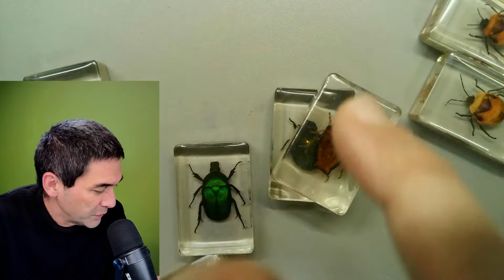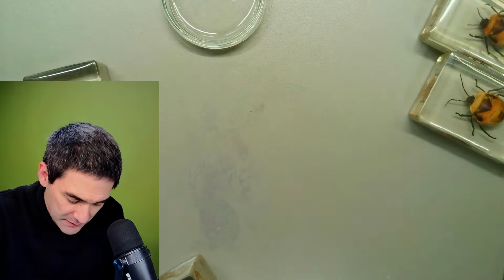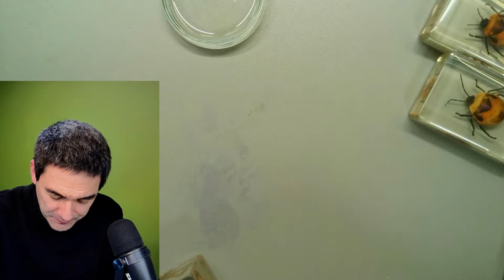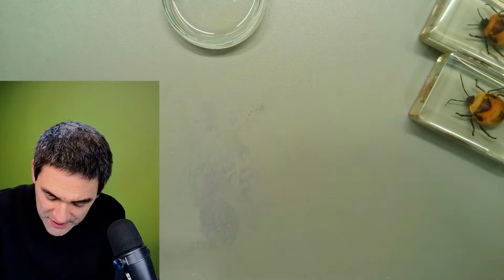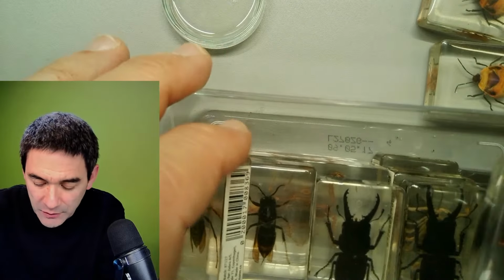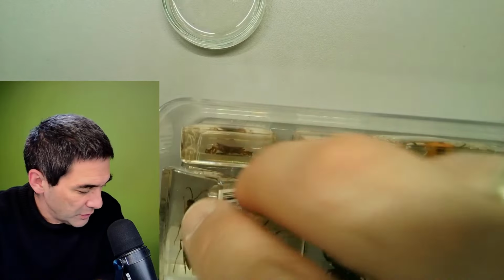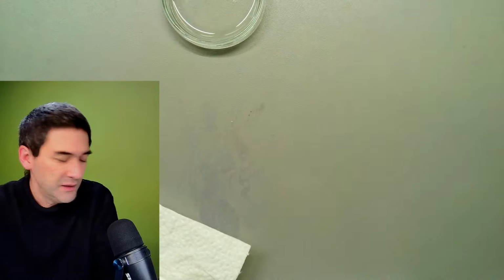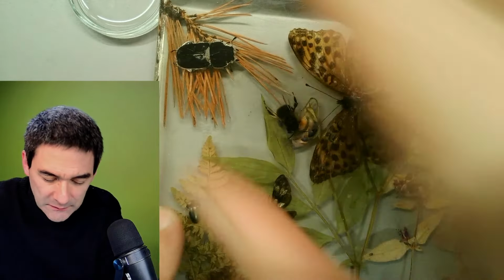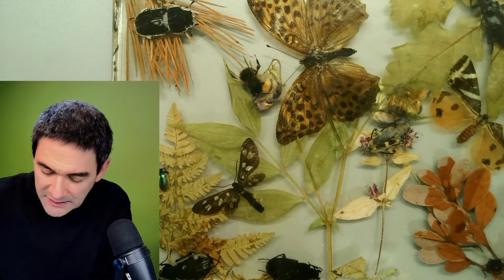So I'm going to have to put the oil somewhere now. And then I'm going to show you something else here. Because I do have another one; these over here are modern ones, right? I do have one over here on the side which seems to be already 40 years old. Let me put this away first. So it goes back into this, and here I'm going to show you this. It's also a resin block, and this one is pretty old. I know that because there was a label on it.